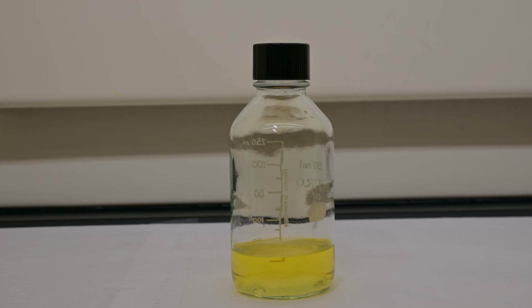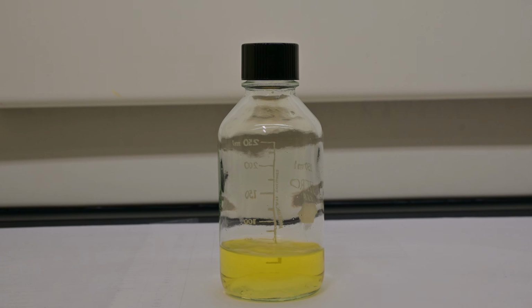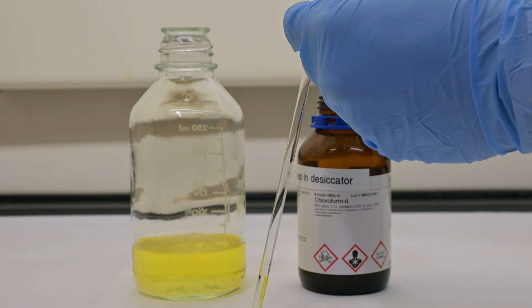Alkyl nitrites can decompose slowly over time, especially when they're exposed to heat or direct sunlight, so proper storage is crucial. I kept the butyl nitrite in a chem fridge until it was needed for the next reaction. If you're aiming for even higher purity, you can always distill the product under reduced pressure, though I didn't find it necessary for this reaction.